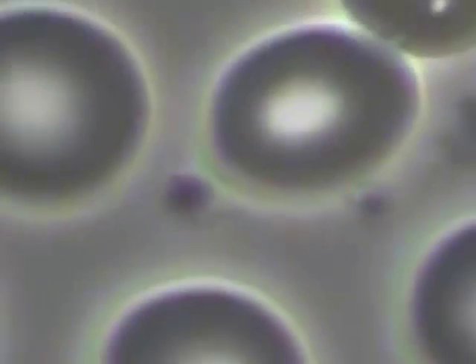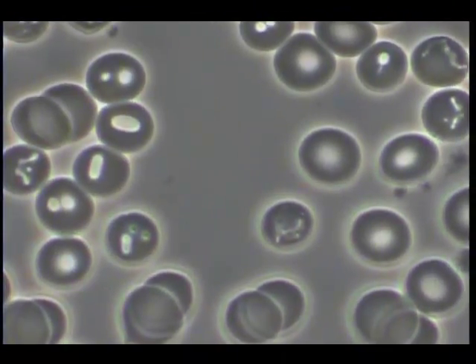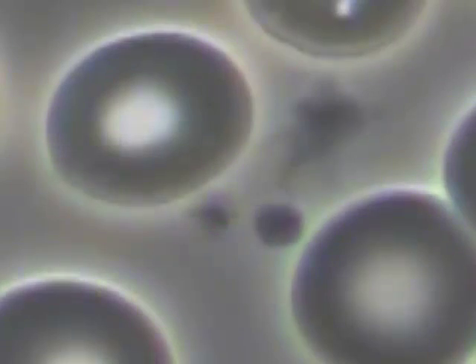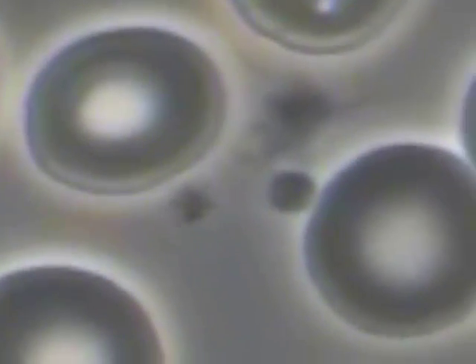This artifact here is a bit curious, mostly because it has an extension out front. This doesn't appear to be a platelet because platelets usually don't have what appears like extensions like this.